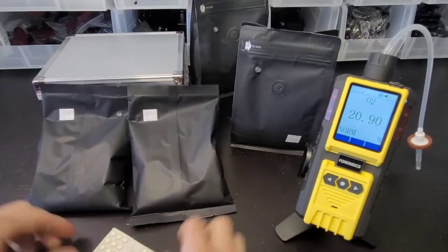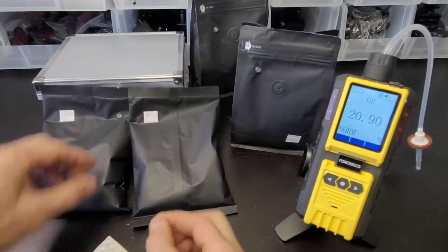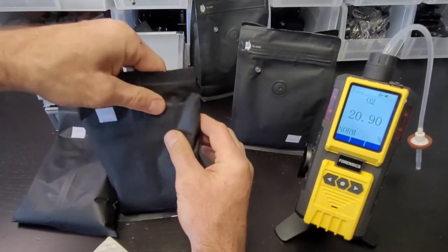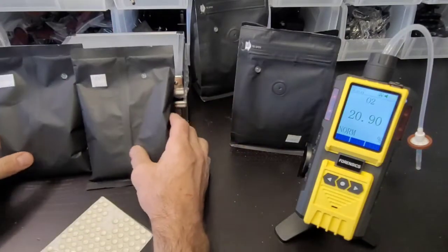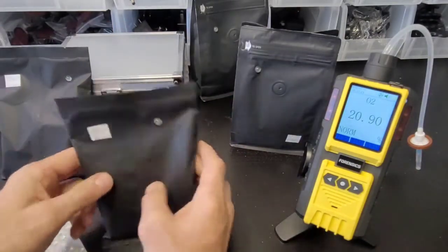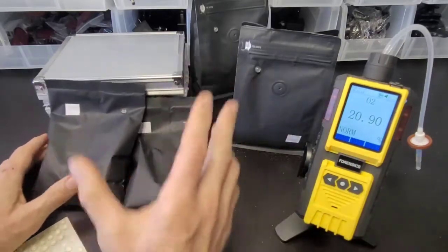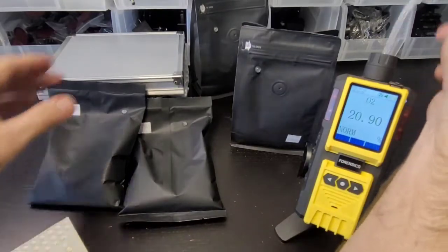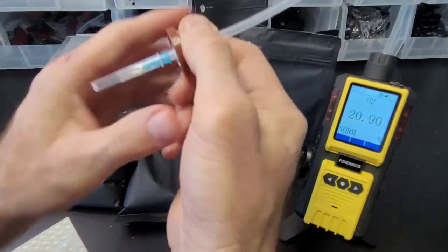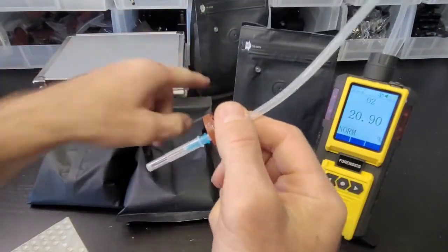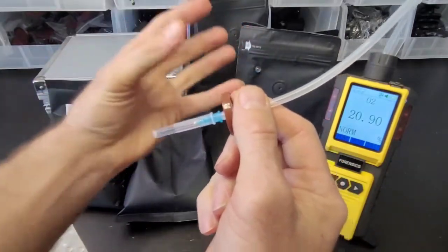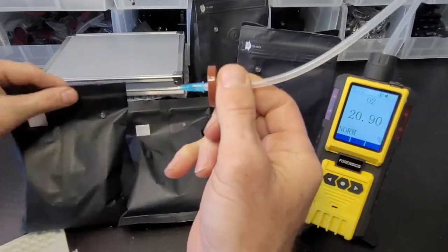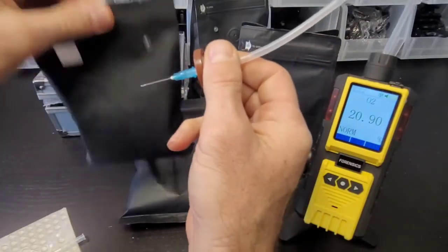Whatever air is there, sometimes for coffee people do a nitrogen flush or a mixture of different gases. For these guys, I don't know what's there. I know they're having some packaging issues and we're going to see if any air is permeating in and if it's retaining its low oxygen concentration. Packaging is very important, especially for coffee - we don't want that coffee to oxidize.